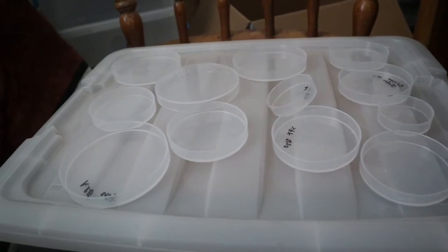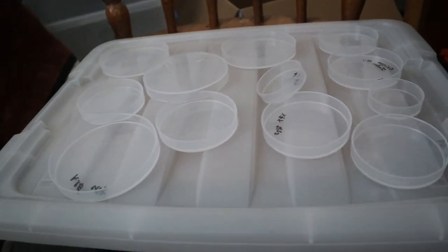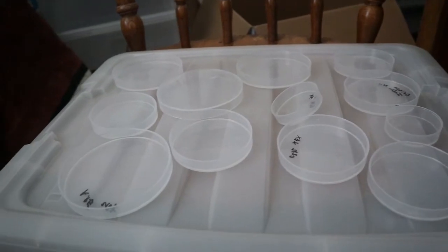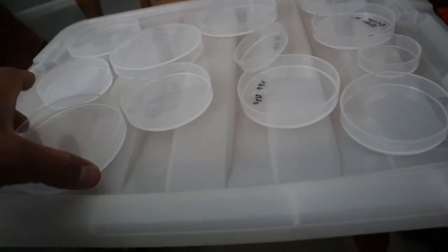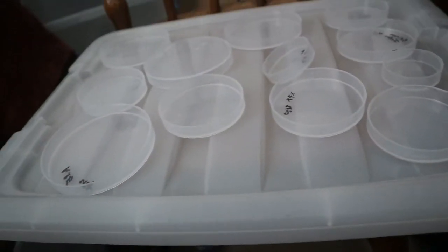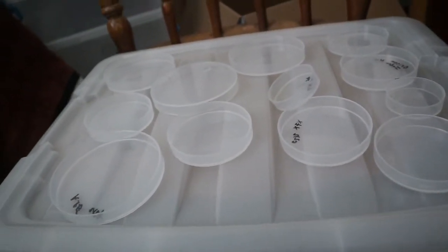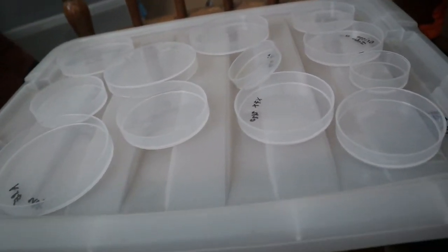As far as time, you can pressure, we're not sterilizing grains. So 30 minutes along with your agar should be fine because we're just basically sterilizing the material, not a whole quart jar of grain that would take an hour and a half to fully sterilize.